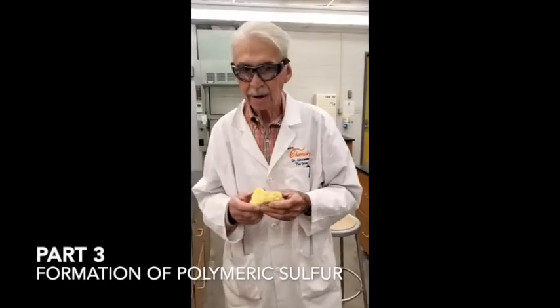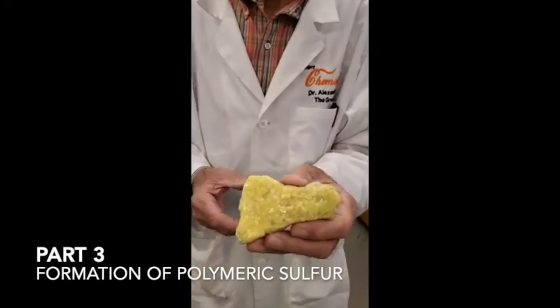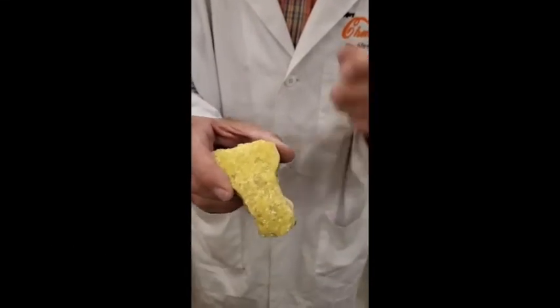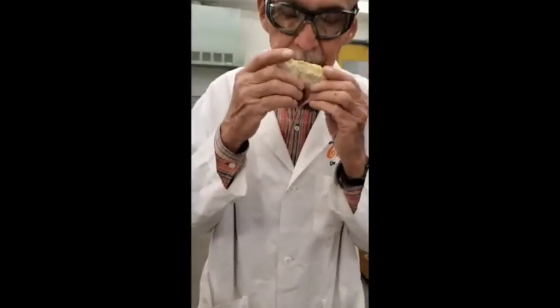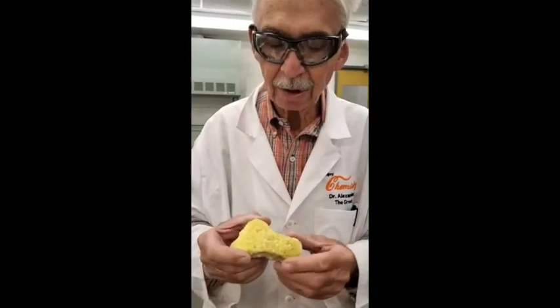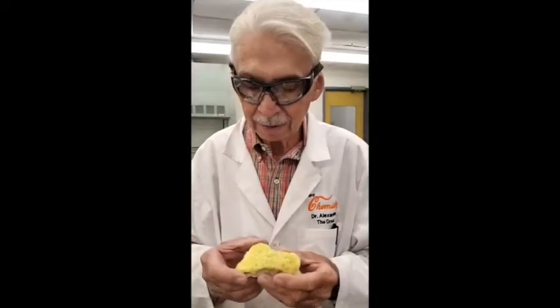By the way, sulfur is found in nature. This is a mineral specimen of sulfur — it's rhombic sulfur, the form found in nature. Isn't it pretty? I can smell it. What I'm actually smelling is sulfur dioxide being produced as it oxidizes slowly off the surface. Sulfur dioxide has a really strong odor, so when you smell sulfur, you're actually smelling the sulfur dioxide coming off of it.